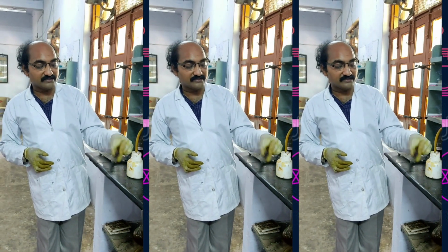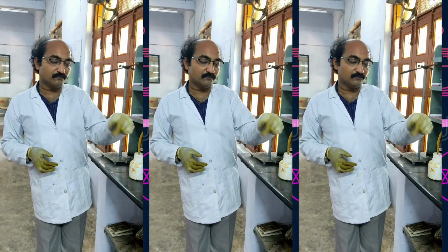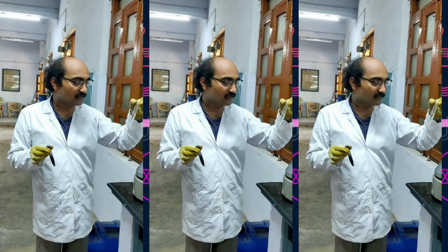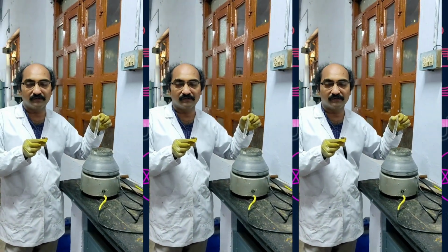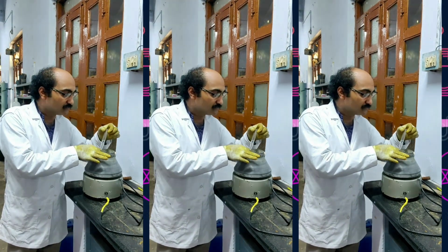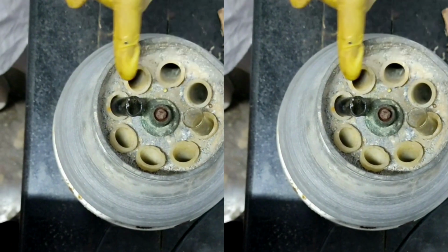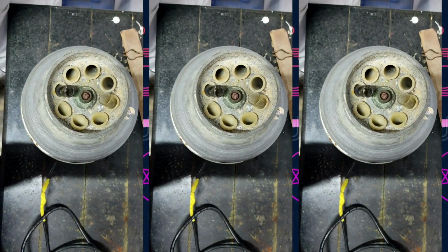Now I am basically centrifuging this one to separate the residue of fourth group cations. The test tube has the fourth group residue, and I have taken one more test tube with distilled water because in the centrifuge machine, never ever should I keep an odd number of test tubes. So always you have to keep the test tubes one opposite to the other like this. In this way, we have to keep them in the opposite holders. Now we need to switch on this machine. The centrifuge machine is switched on now.